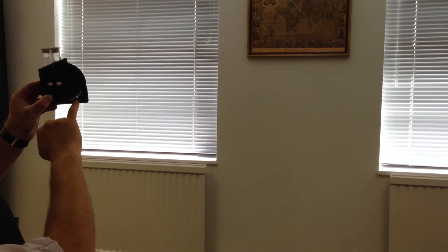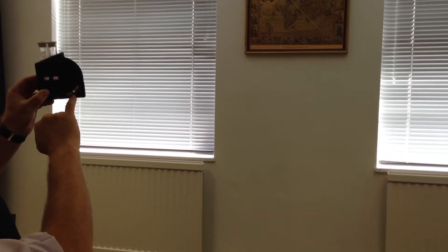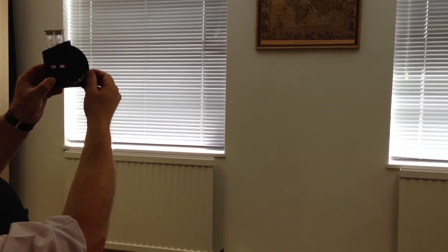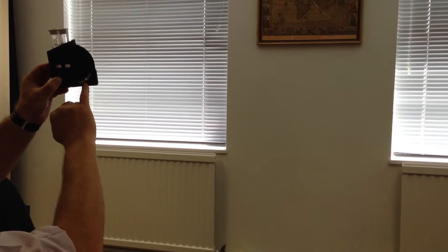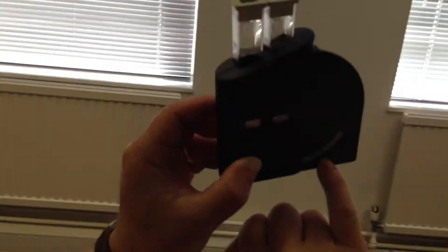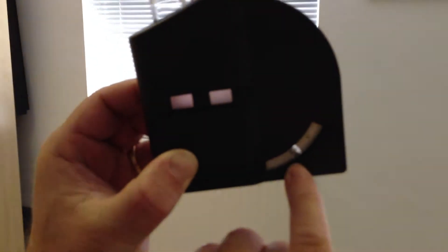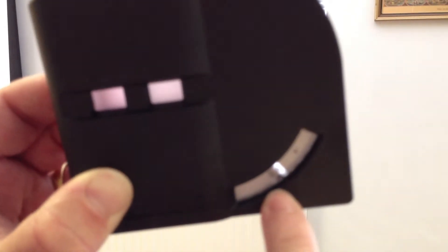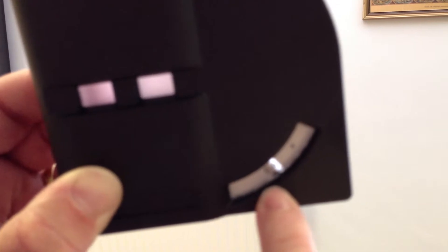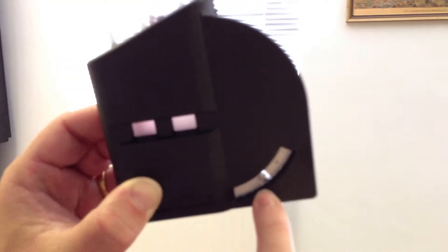As you can see here, the result is shown on the disc which is graduated and we have matched the colour to 0.4 ppm. As mentioned earlier, the acceptable limit of chlorine is 0.5 ppm of free chlorine, and this reading is within specification.